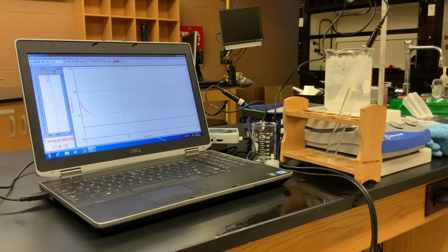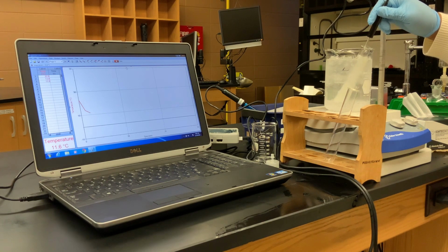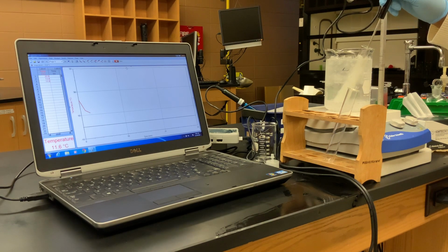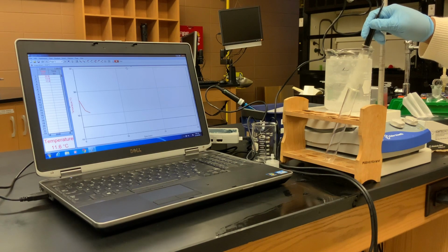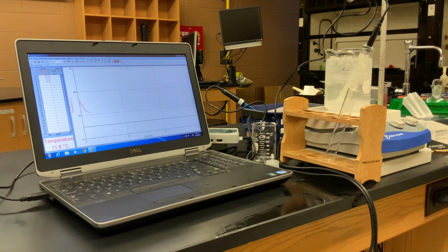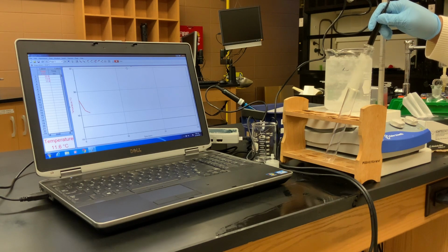We've got our third temperature at minute number 3, 11.6 degrees Celsius. And I'm starting to feel that my biodiesel is now gel-like. It's no longer a liquid. I would say it's a solid liquid mixture, kind of like Jell-O. So we can say that it's a mixture of solid and liquid. It's very gel-like, and it's very hard for me to move the temperature probe in it now.